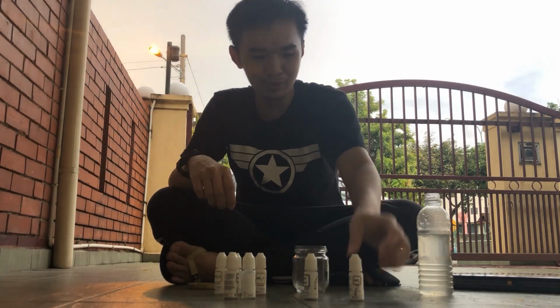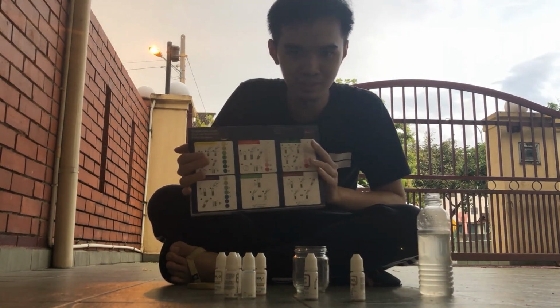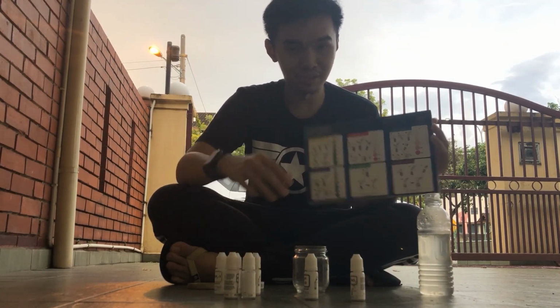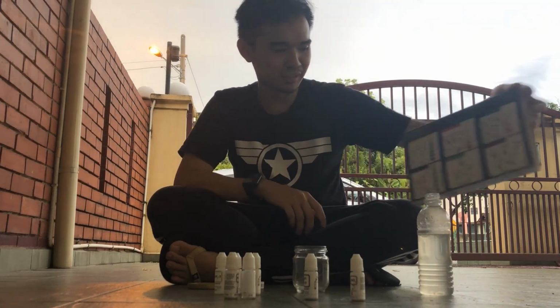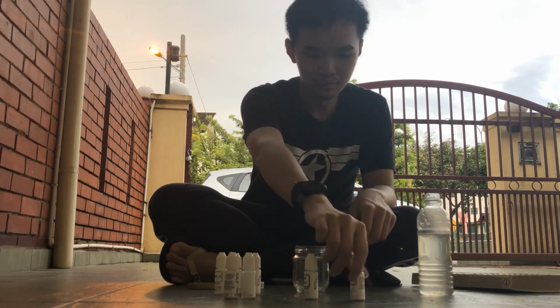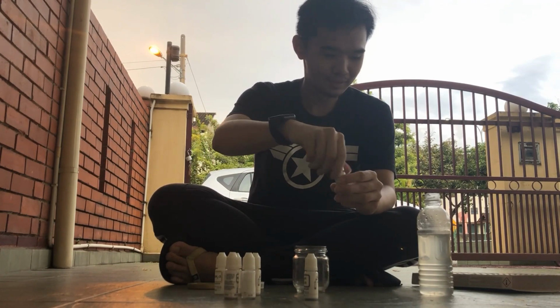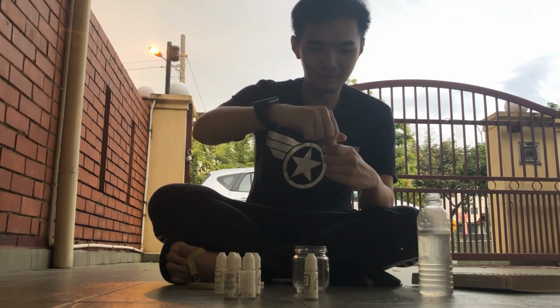So how are you going to do the water quality testing? I'm going according to how the procedure stated. For different kinds of chemicals, you need different procedures to measure their content. So I'm going to do nitrite first. For nitrite, you only need to drop it one time, 5 drops.